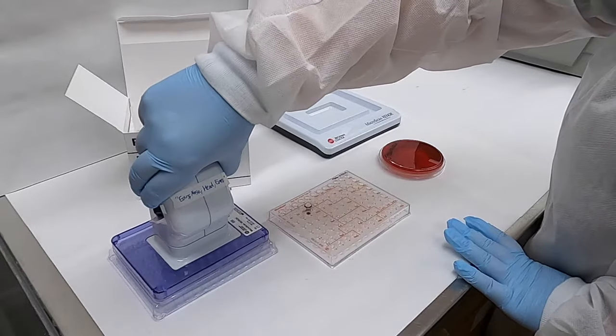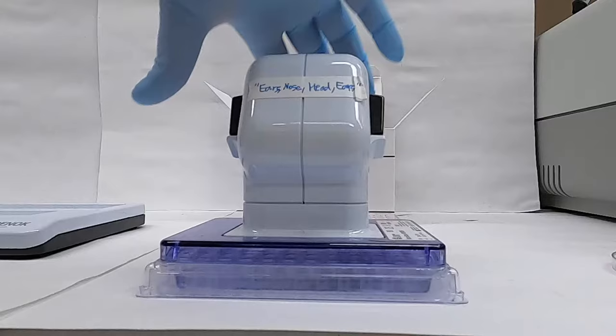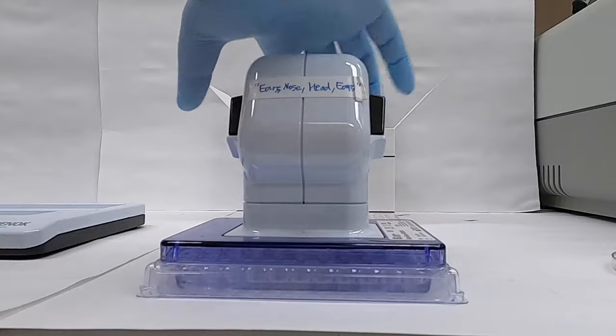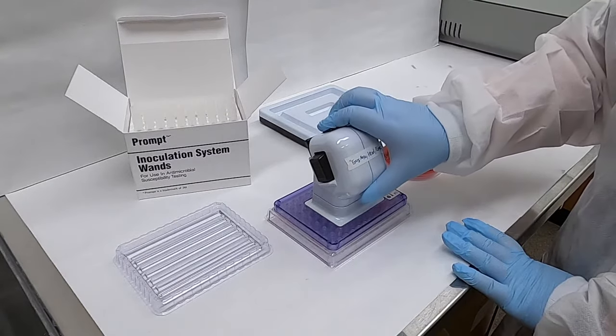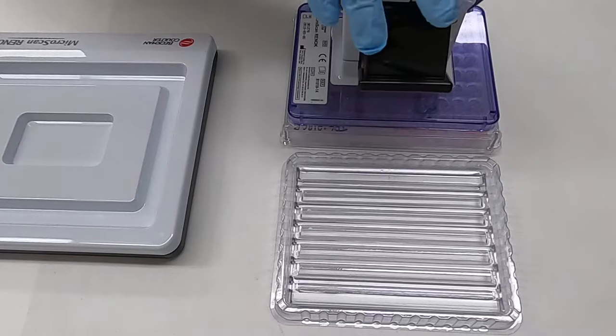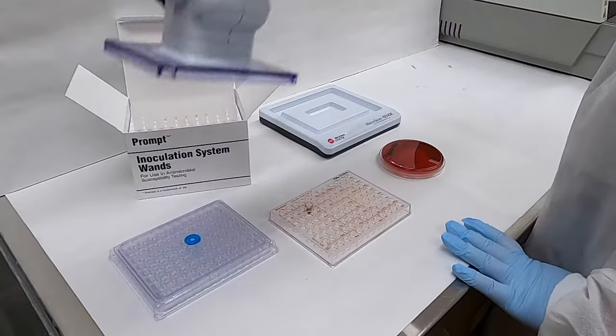We use this specialized pipetter system to draw up our bacteria. As you can see here it's being primed, transfer the entire device over to our 96-well plate, release the suspension, and then move the sampling device back to the reservoir.